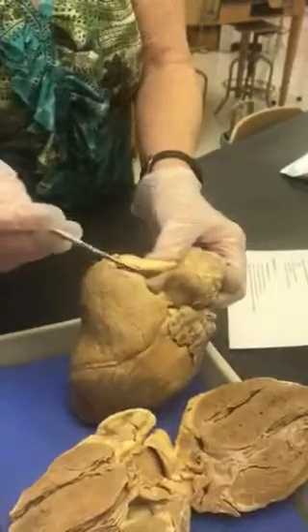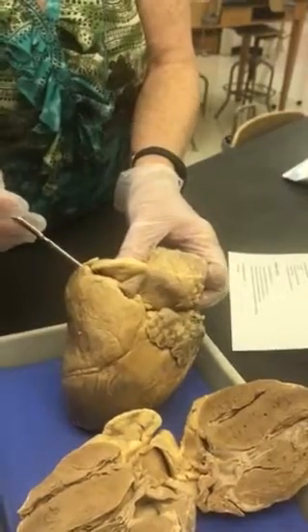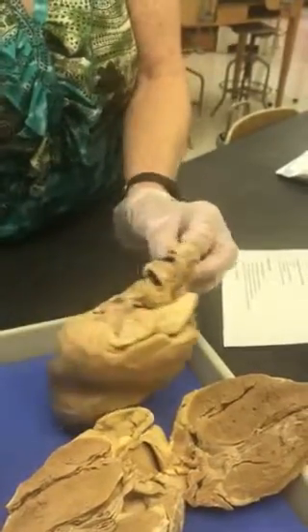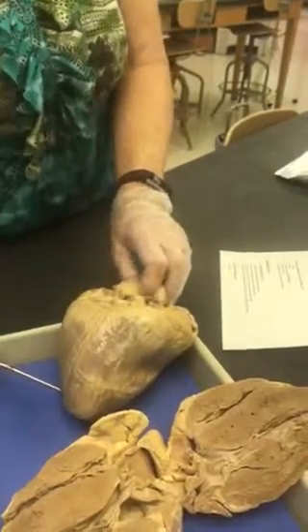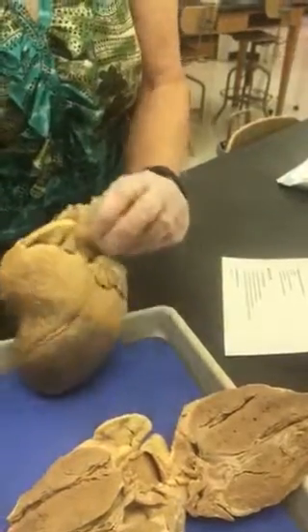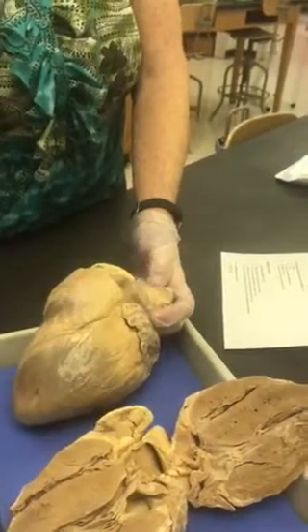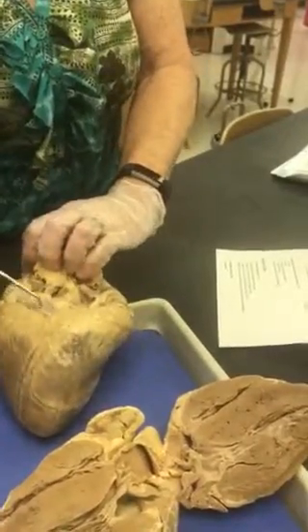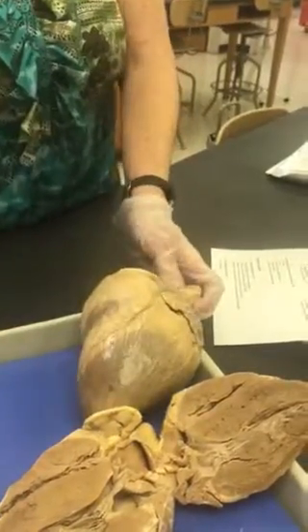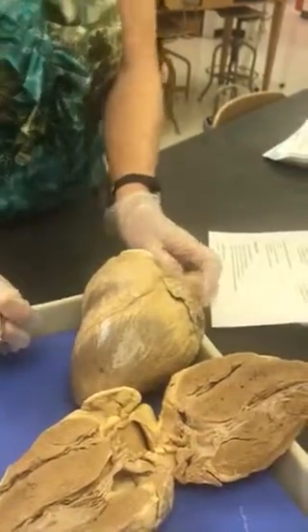The large artery found in the right coronary sulcus is the right coronary artery. And then on the posterior aspect of the heart, you have the posterior interventricular artery. The only vein I ask you is the great cardiac vein. It's the only one you have to know. You do have to know where it enlarges. It forms the coronary sinus. I think that's everything on the outside of the heart.